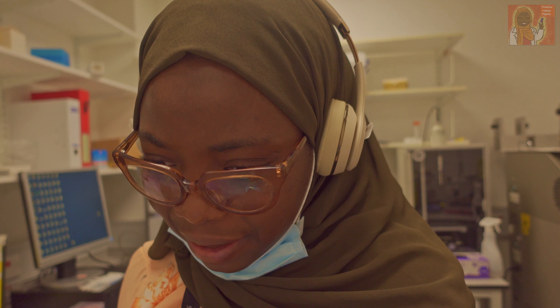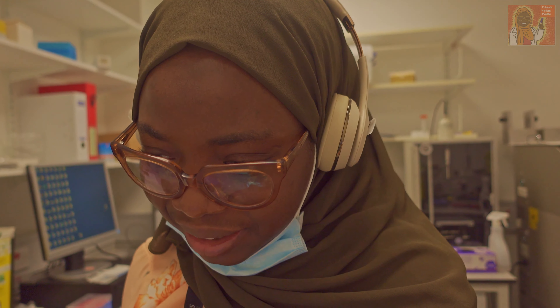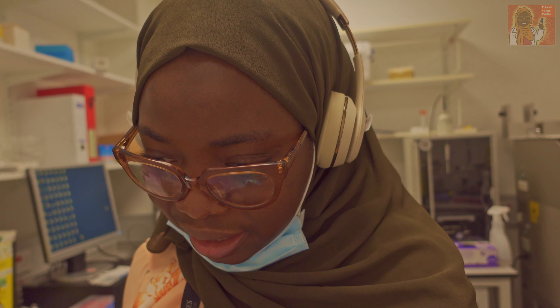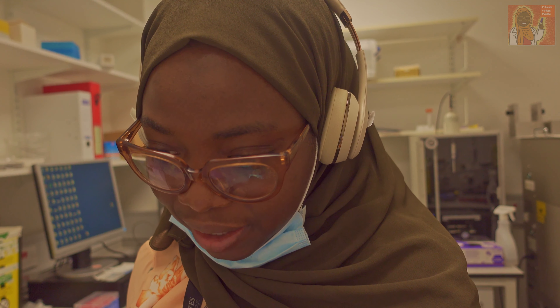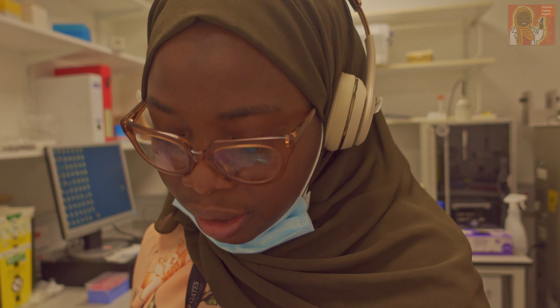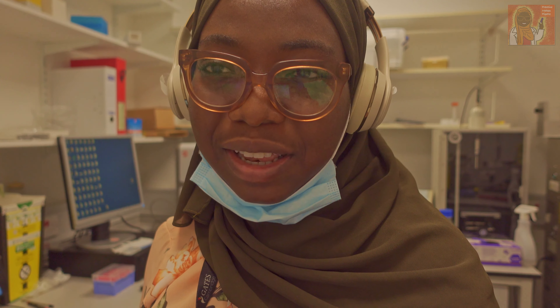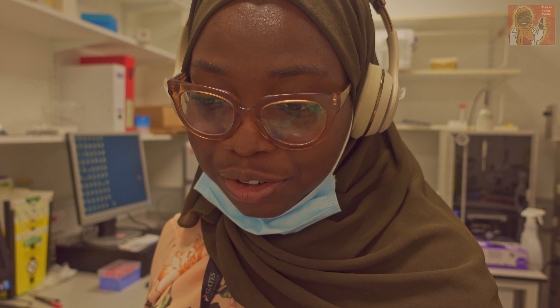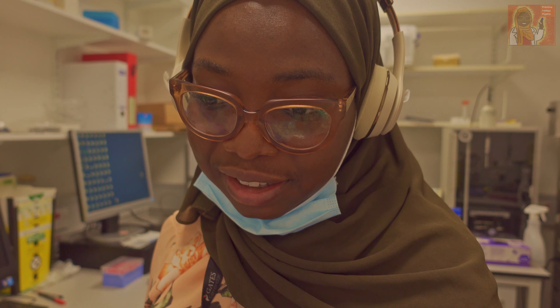Hi guys, I'm here again checking my data for today's batch. I can't find my ladder — oh wait, I think I forgot to put the ladder in, that's why it's not showing. The good thing is there's also an electronic ladder you can use if your physical ladder isn't present.